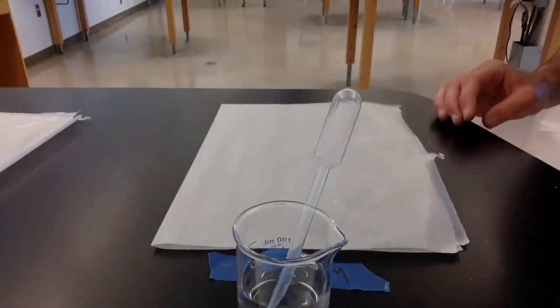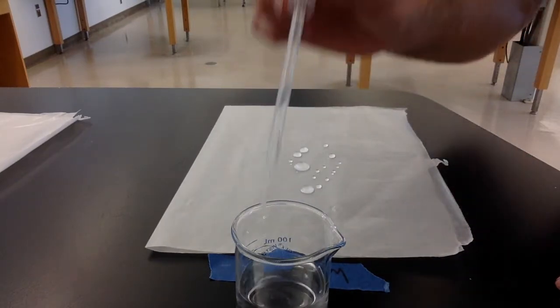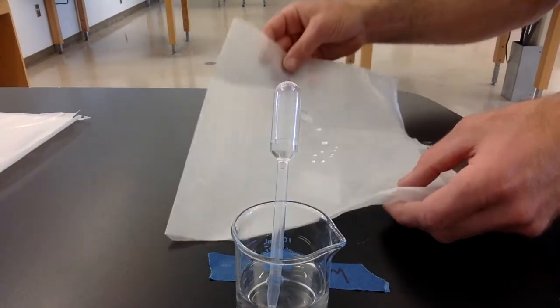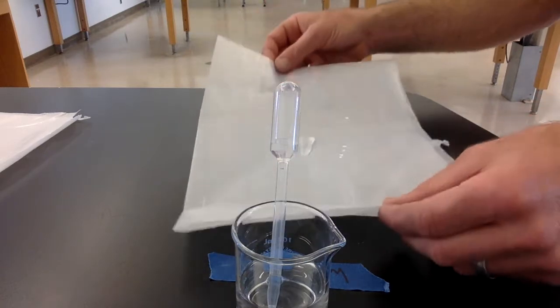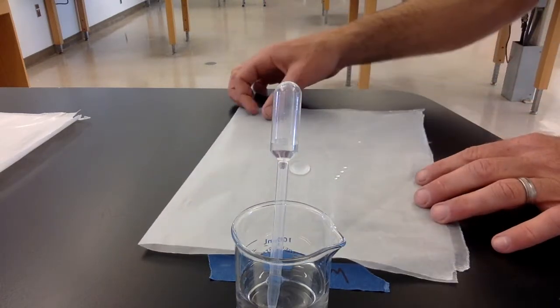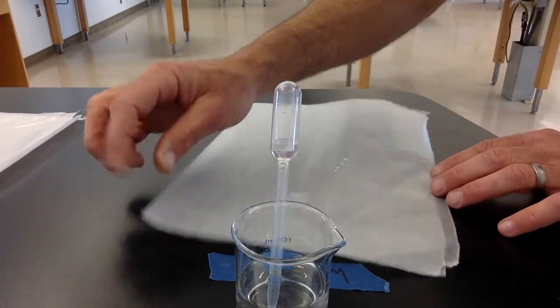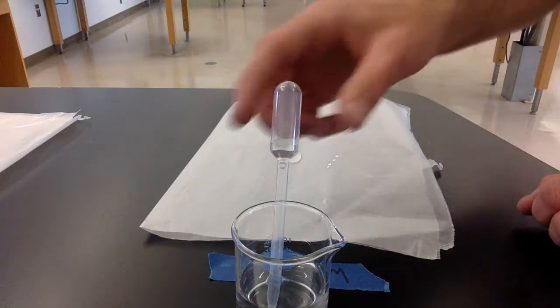So our next activity is right here. And so I have some water, and this is a piece of wax paper. So I'm going to take the water and put some drops of water on the wax paper. We're going to see how it behaves. So we're going to slide it around and see the drops that it forms, how it moves around. It's all gathered into one big droplet of water, and it moves across the wax paper in one big drop.